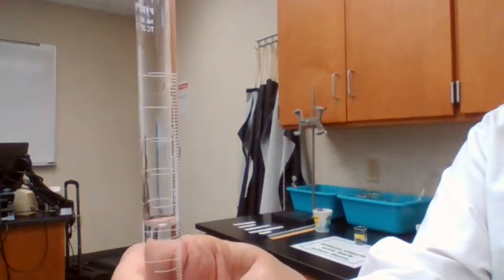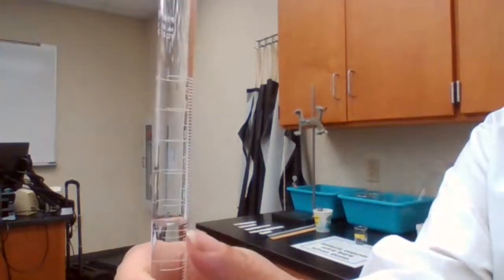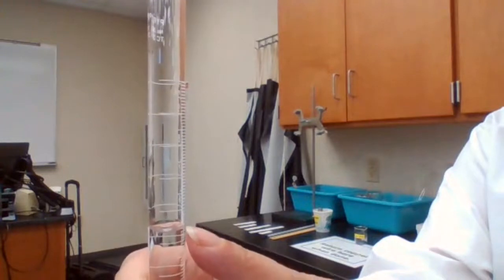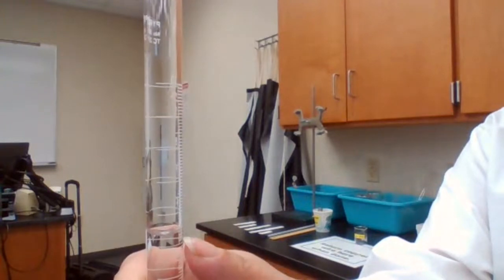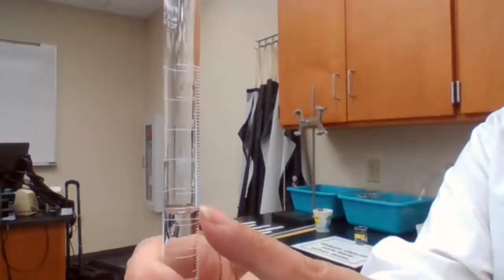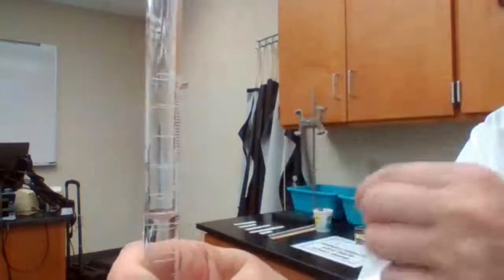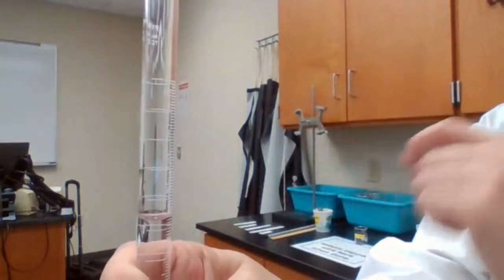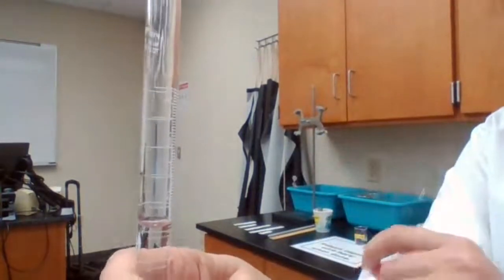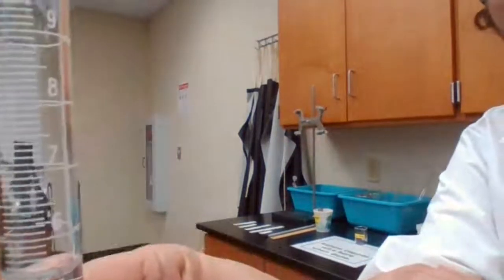And that part is the exact number, so it's not estimated. Nobody is going to estimate this at 5.2 because it's actually over 5.3 and less than 5.4. So now your estimated number is going to fall under the hundredths place. The second decimal place is going to be the estimated digit, between 5.3 and 5.4.